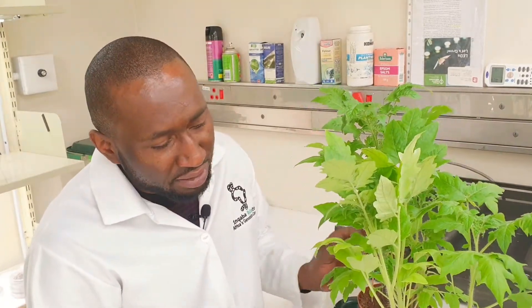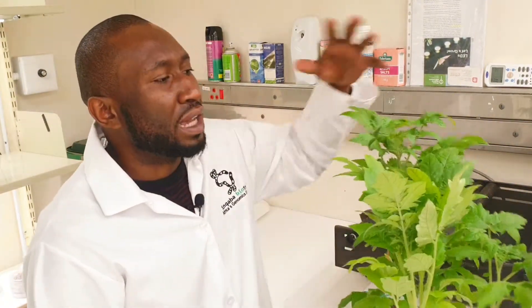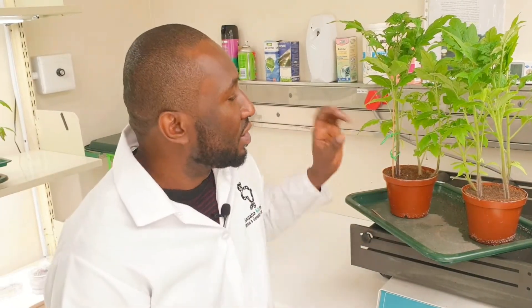Another thing you can do is prune the plant, taking away shoots that are not growing normally. I don't water on the foliage because it can lead to contamination — I water on the tray so the pot absorbs water from the holes underneath. Research shows that pruning abnormal shoots enhances the production of heavier and bigger fruit.